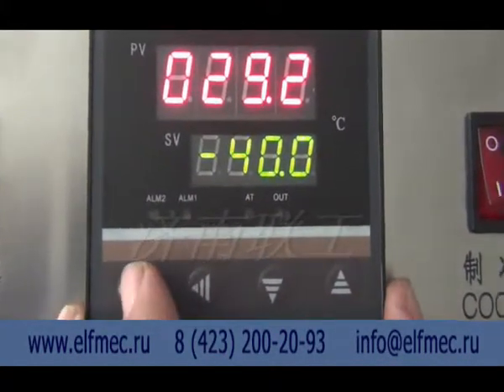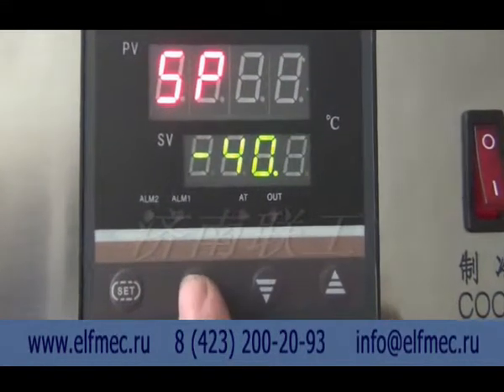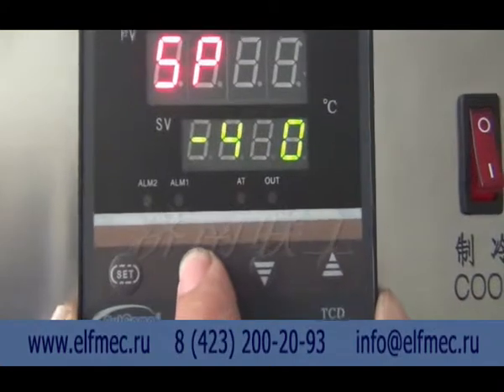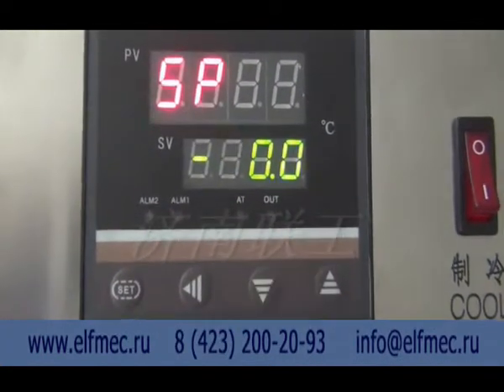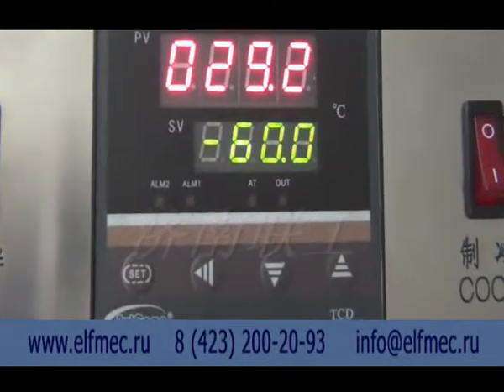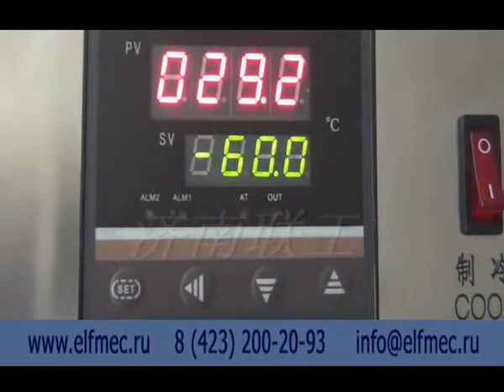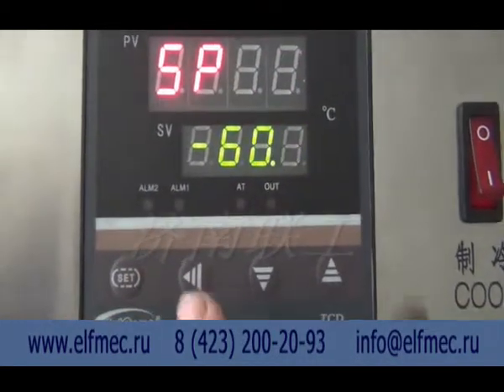Set up the temperature according to the scope of application. PV stands for actual temperature. SV stands for setting temperature. Set stands for the confirm button. Set up the temperature according to test requirements. Specific steps are as shown in the operation manual.